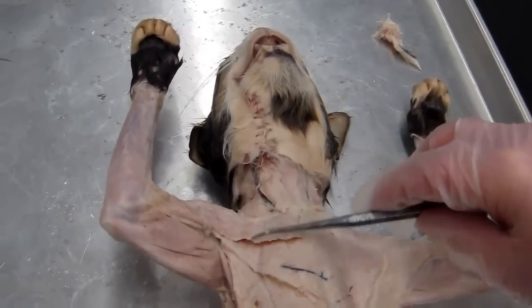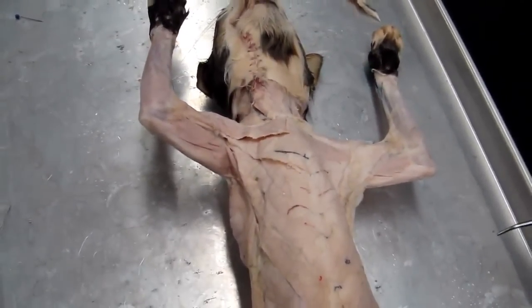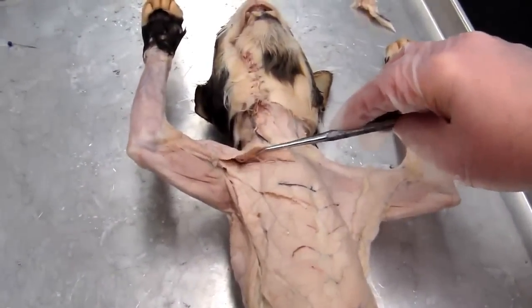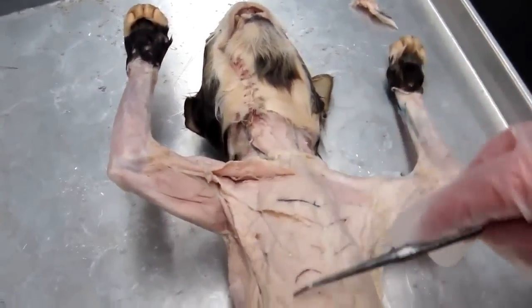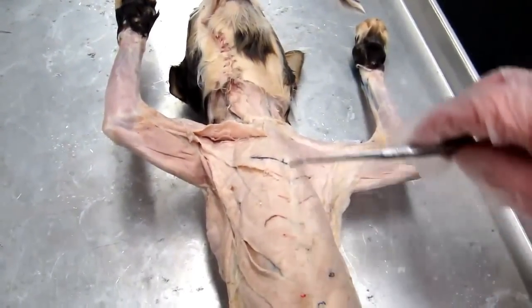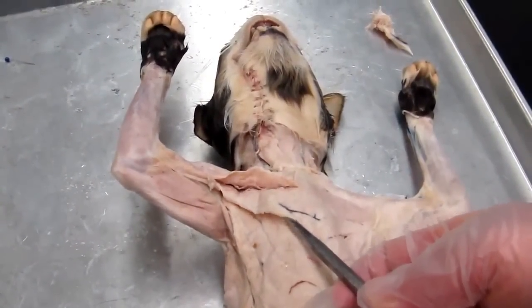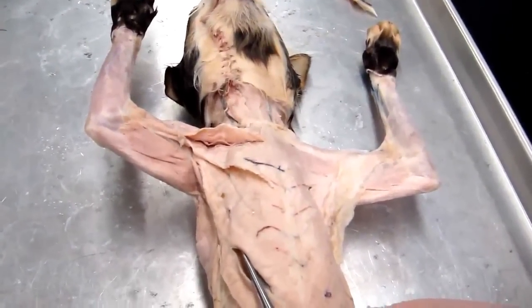Okay, now let's move to the anterior chest wall. And we have a little bit of a complication in the cat because the cat has a few extra chest muscles here that we don't have to deal with. This one is an extra muscle, so we're just going to kind of flip this one out of the way a little bit. Okay, and then we have an extra muscle down here, so we're just going to kind of push that out of the way. Okay, so these two muscles are the muscles that we're interested in. This one that I'm lifting up now is the pectoralis major, and this one here is the pectoralis minor.